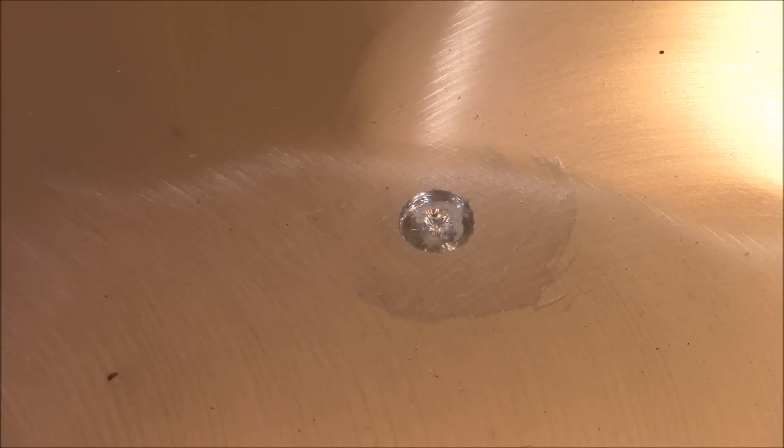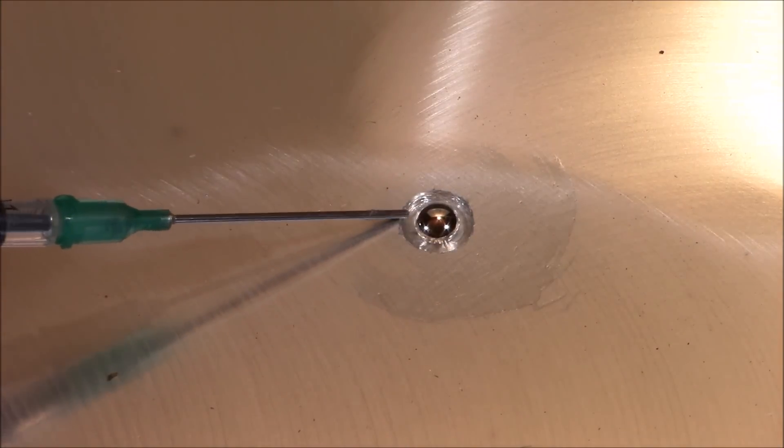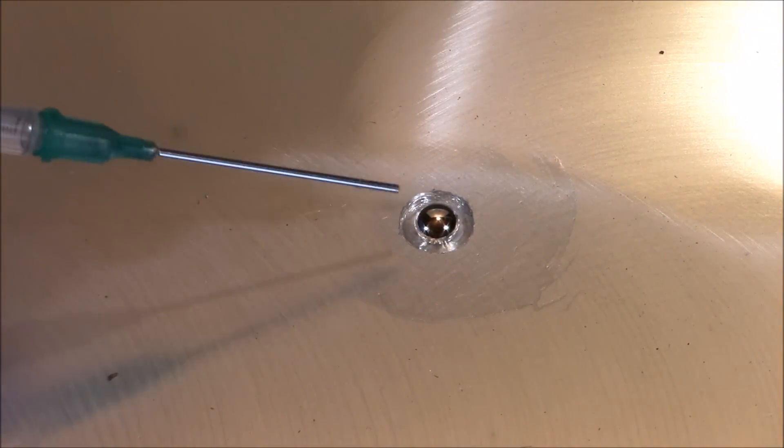Now it's time to add the mercury. The major thing going on here is the combination of the mercury with the aluminum to form the amalgam. Some of the amalgam that forms gets dissolved in the mercury and makes its way to the top. When it gets there, it comes in contact with oxygen in the air and it reacts to form white aluminum oxide.